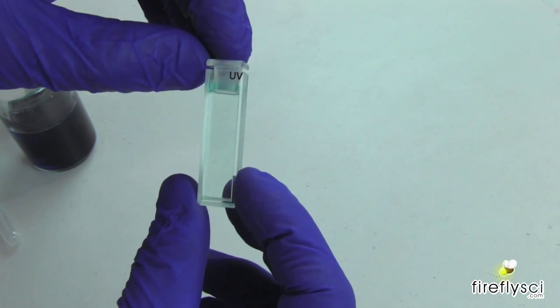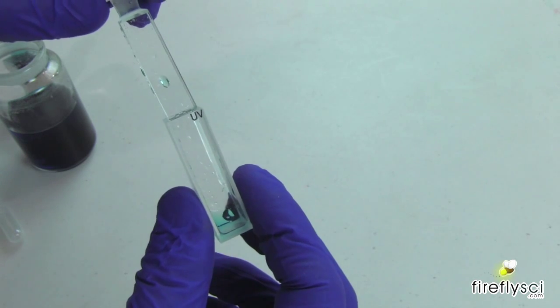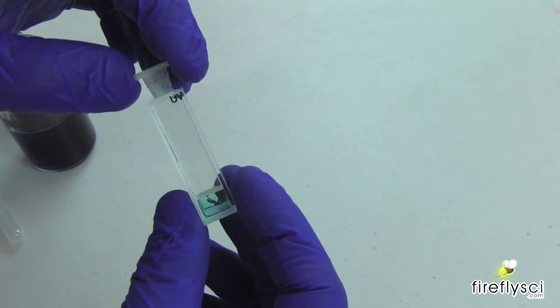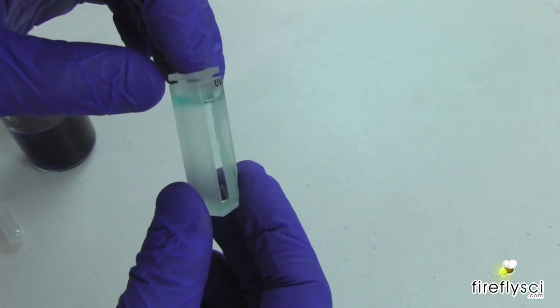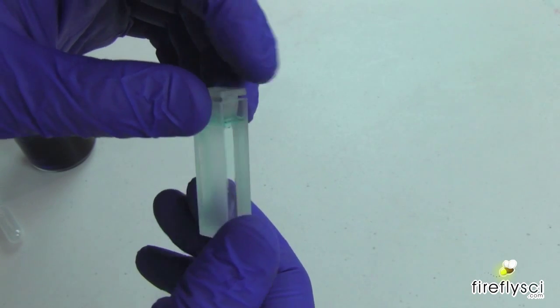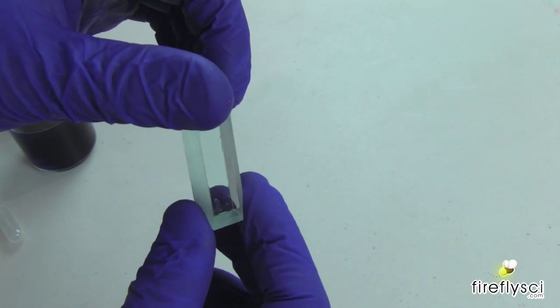And you're all set to go to test your sample here. So, one more time, we'll show you how it goes in. Just slide it straight down in, and watch, see it goes right up to the top. Pretty cool, huh?